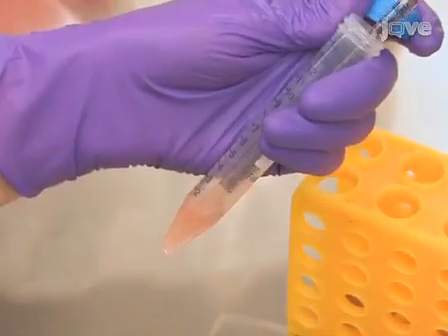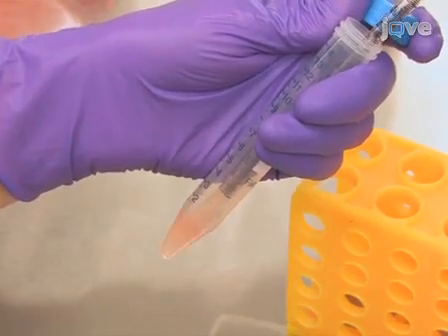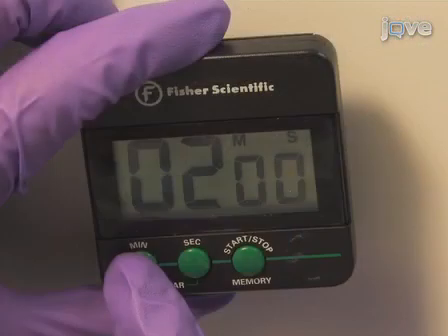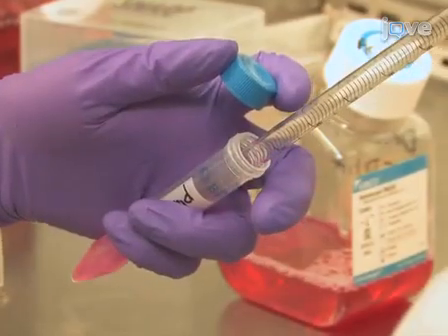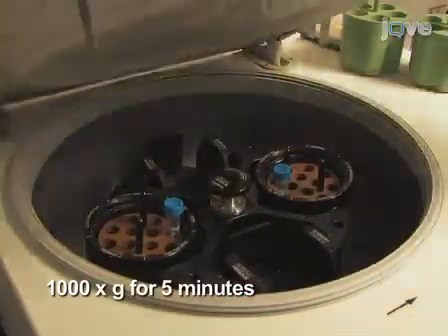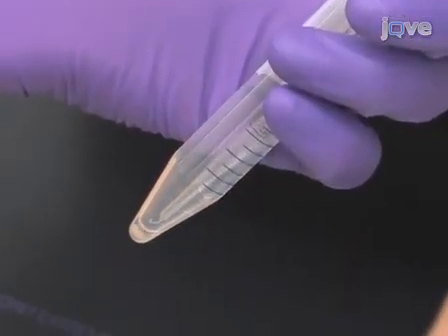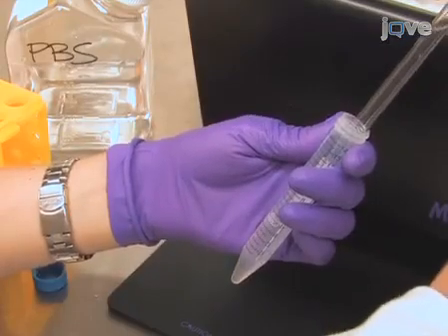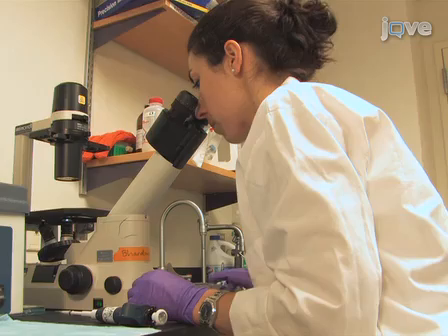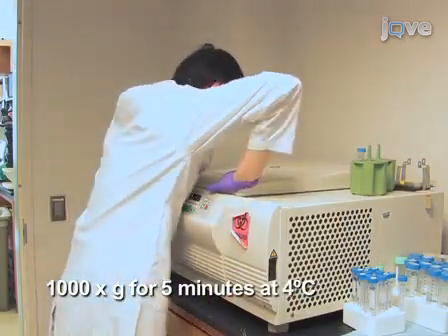Continue by resuspending the cell pellet in ACK lysing buffer, adding 2 milliliters per spleen. Incubate for 2 minutes at room temperature. Add RPMI medium up to 20 milliliters and centrifuge at 1000 times G for 5 minutes. Finally, resuspend the cell pellet in sterile PBS. Determine the cell number and centrifuge at 1000 times G for 5 minutes at 4 degrees Celsius.